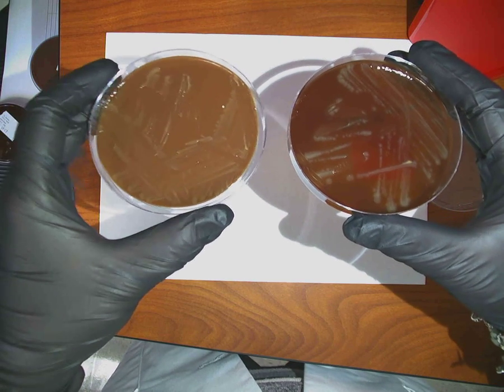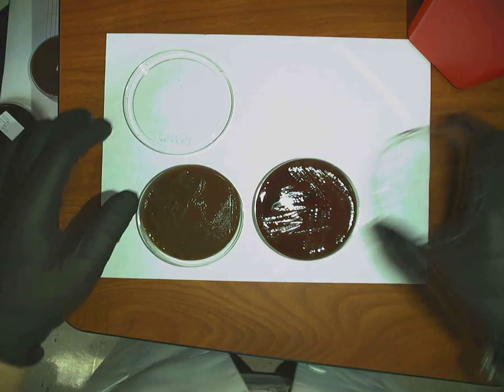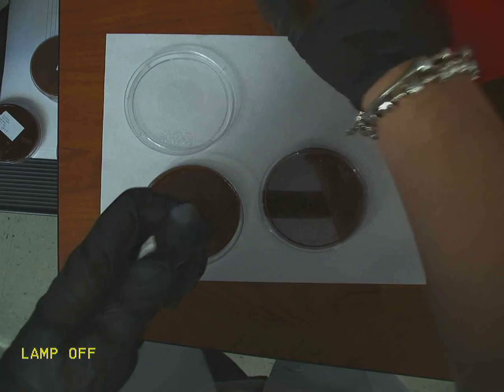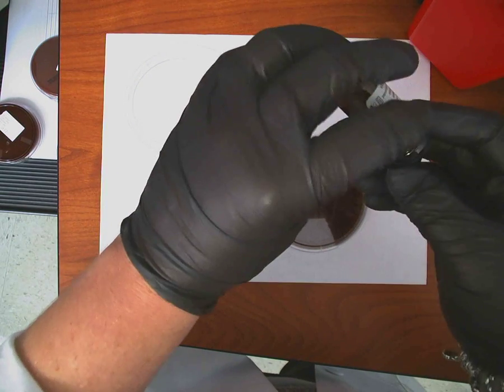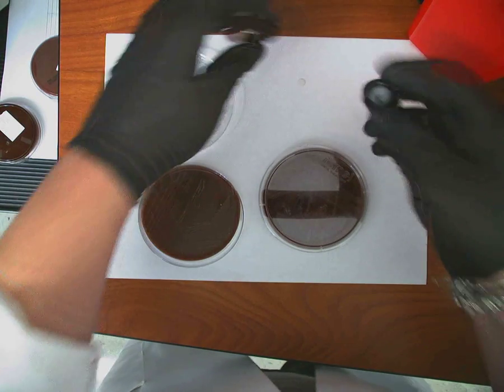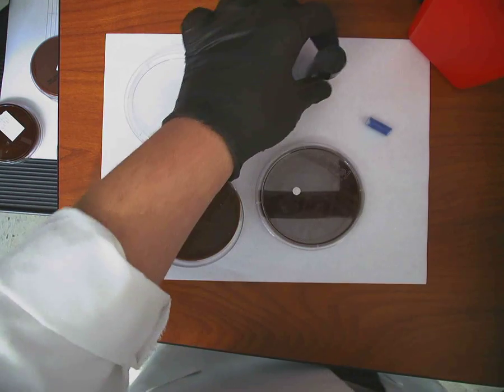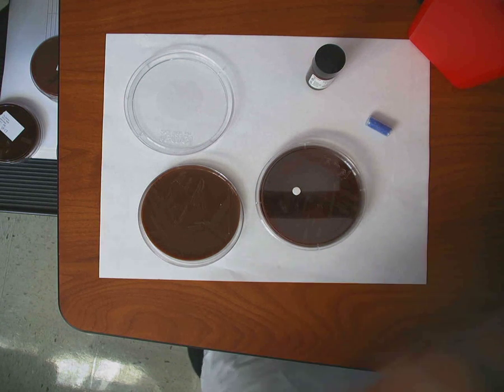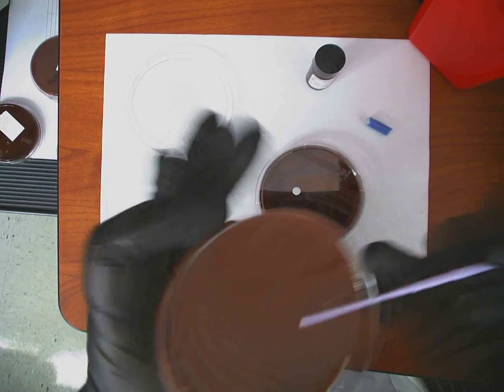The sugars. What if you did the DNase? Okay, so let's do that. Let's look at it. Turn the lamp off. We had the lamp off last time, right? So if I think it could be Moraxella, and I want to do a DNase test on it, what do I expect the reaction to be? I'll expect it to change color, right?